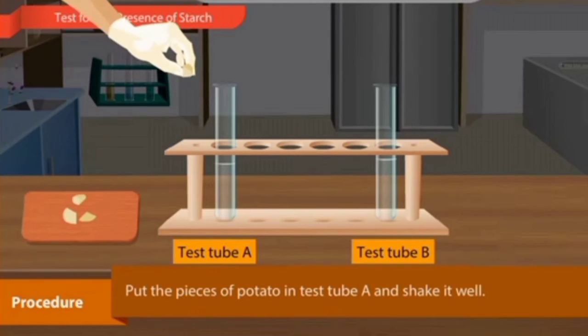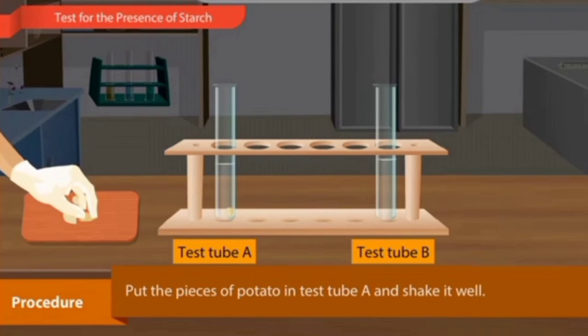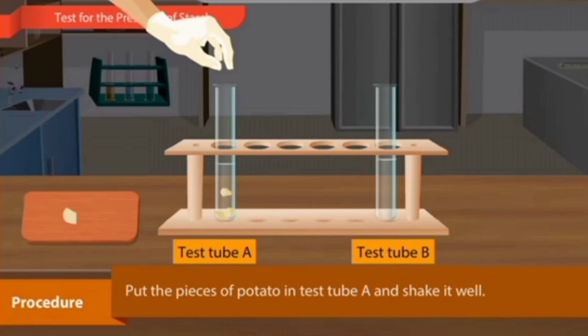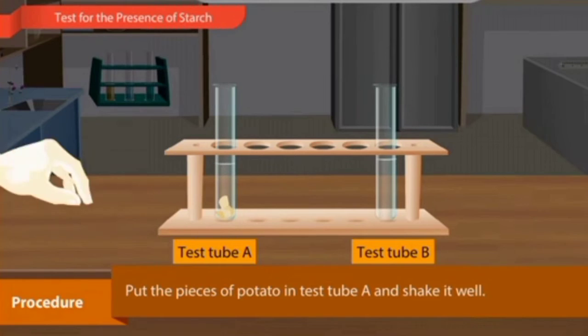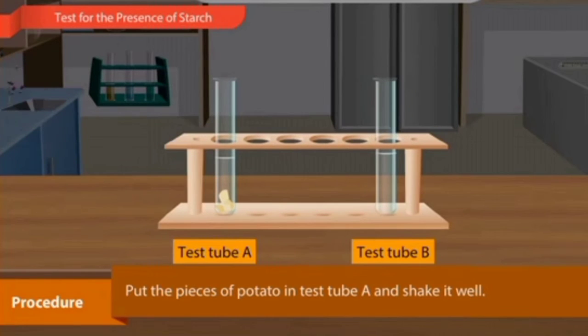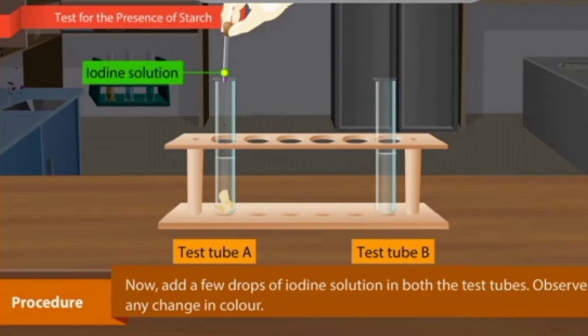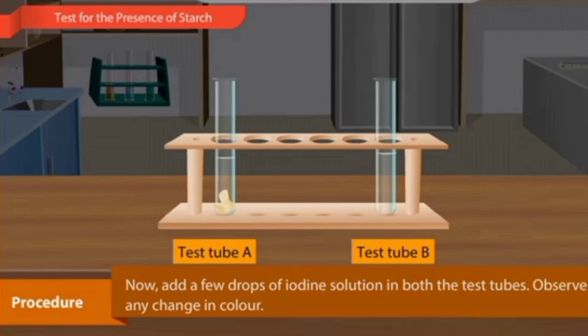Then add the potato paste you have already made in the common procedure to test tube A, and shake it well. The next step is to add a few drops of iodine solution in both test tubes, and observe any change in color. So you have to wait for the change in color.